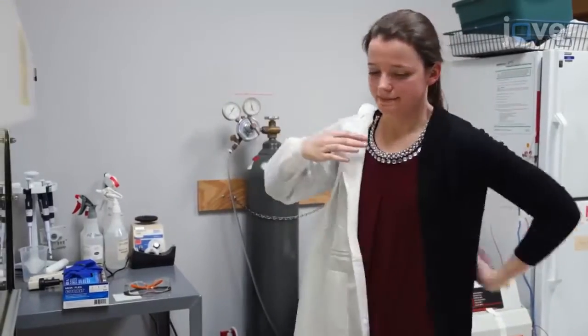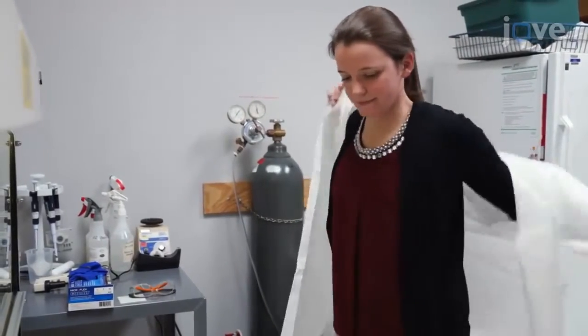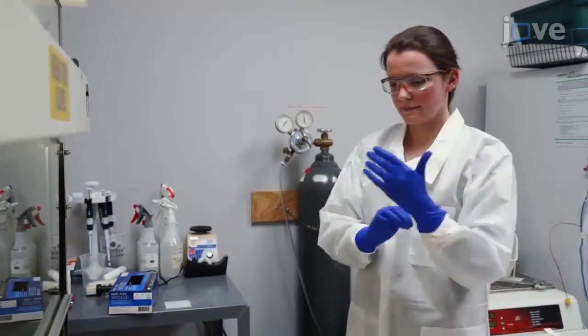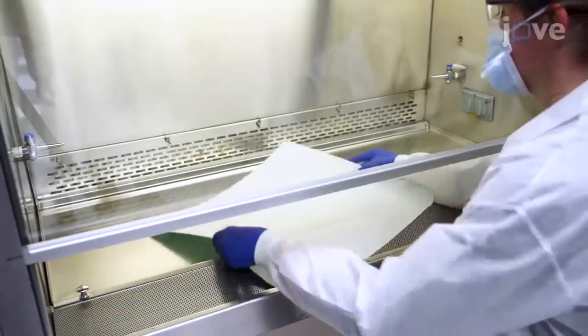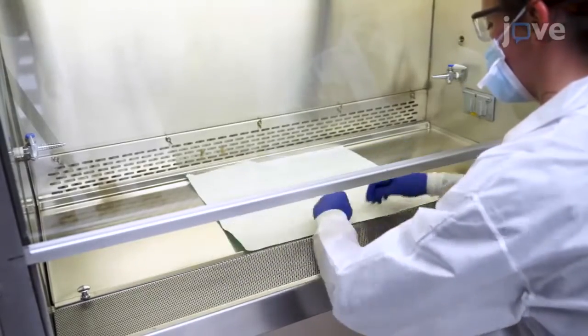Before starting a C. jejuni or C. coli culture, put on gloves, a lab coat, and safety glasses, and place a disposable protective sheet within a disinfected laminar flow safety hood.